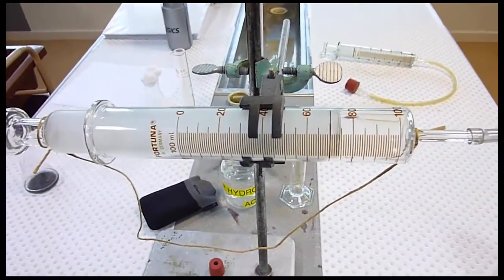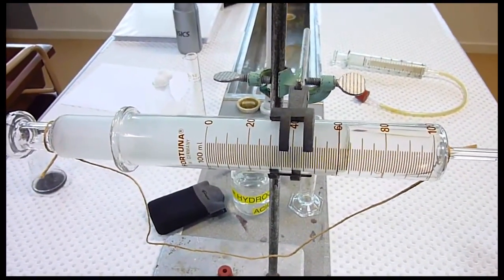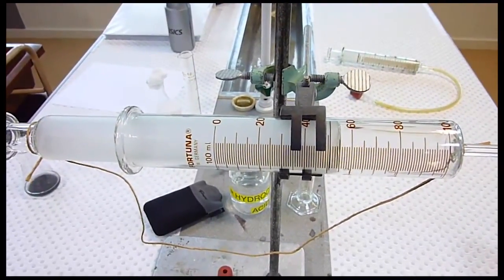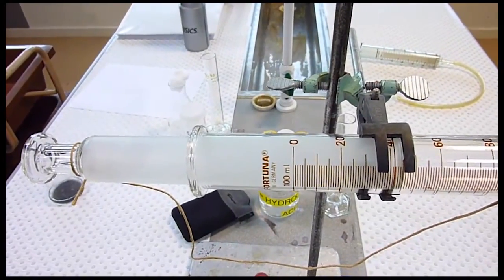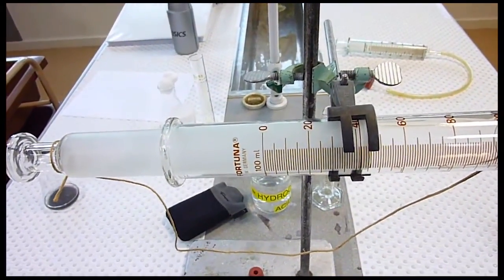Okay, you can see the gas is being produced, and I could take readings at different times allowing me to calculate the gas released and the reaction rate.